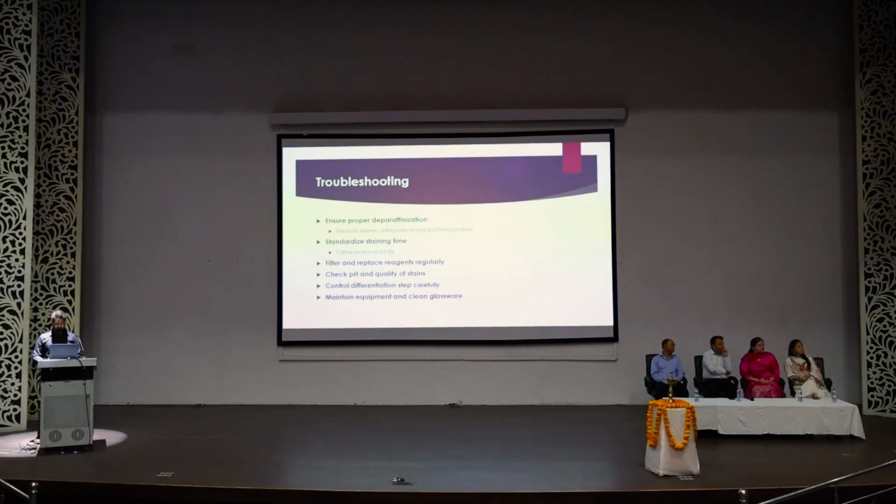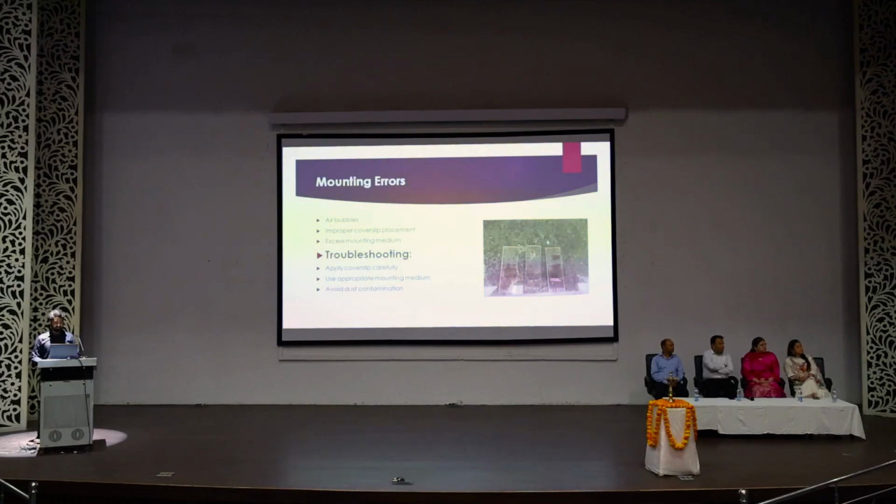Mounting. After the staining is complete, the last step is mounting. Common errors that occur during mounting are air bubble formation, improper cover slip placement, and excessive use of mounting medium. As you can see in this image, it is not clear. You can see the cover slip is slipping towards the right, and here also, and it's not the right way. Solutions for these common errors are: keep the stained slide in xylene and apply the cover slip properly. Use appropriate mounting medium and avoid dust contamination and excessive mounting medium.